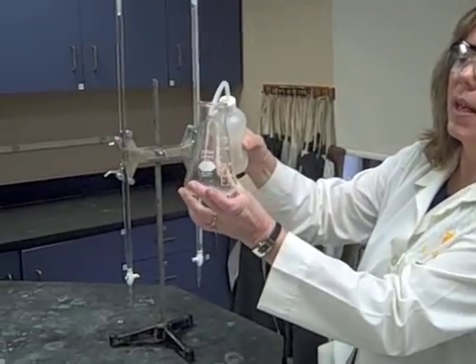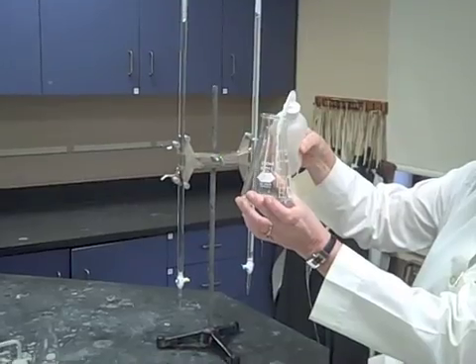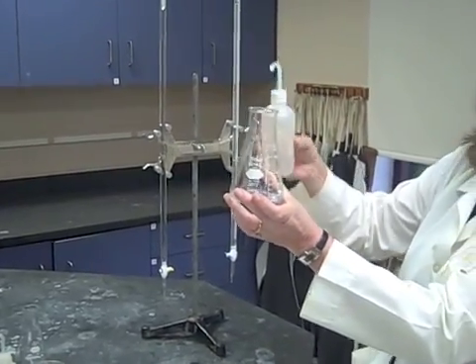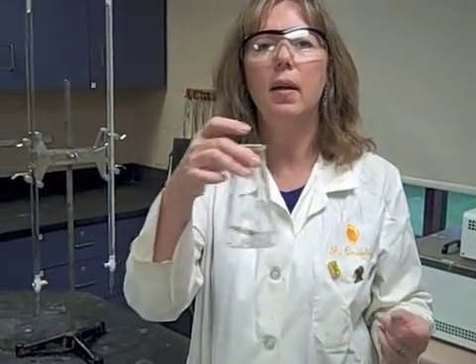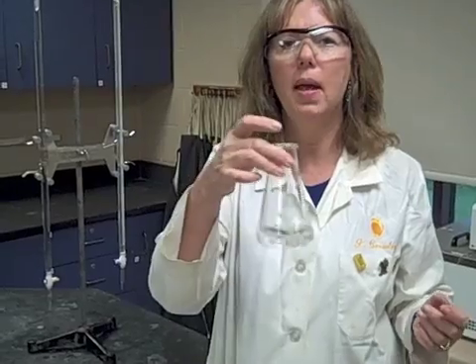I'm just now going to add enough water. And I do try to keep that level the same to about 50 milliliters. The reason why we do this is we want to get a nice endpoint, a nice faint pink endpoint.